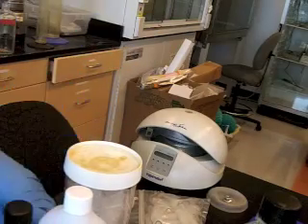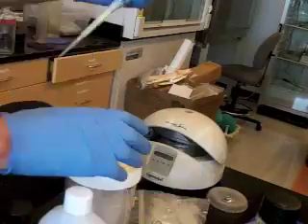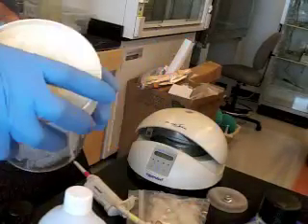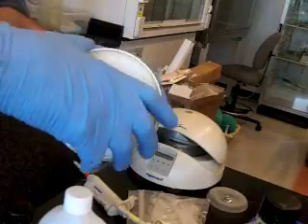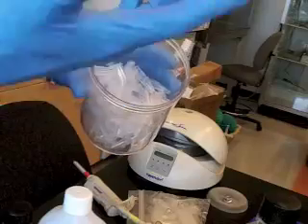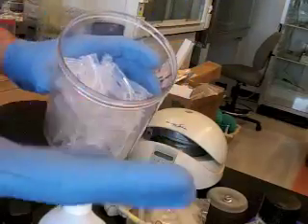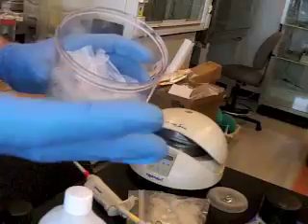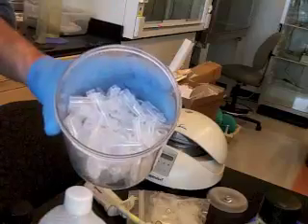So let's just, to show you, pipette the first volume, the big volume first, and here's another thing. I shouldn't have gotten that tip ready because I'm not ready. And here's another thing. So we're going to open this up. We kept it covered. These are tubes, and rather than putting our hand in there, even though our gloved hand is relatively clean, we also now, because we've been wearing gloves for a while, consider our gloves to be kind of dirty. So we wouldn't just put our grubby gloved hand in there.